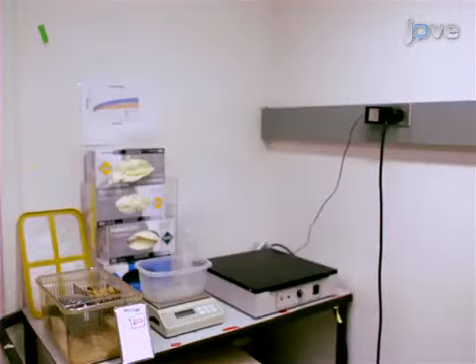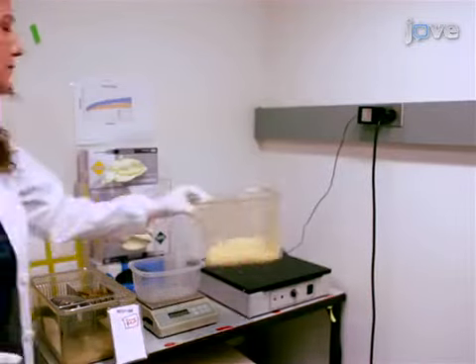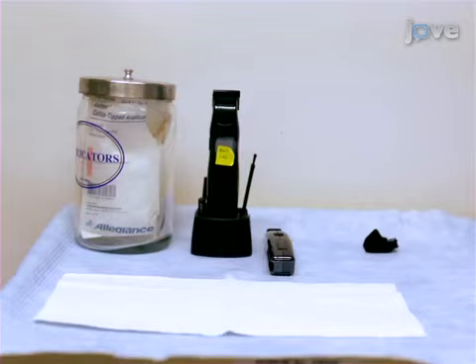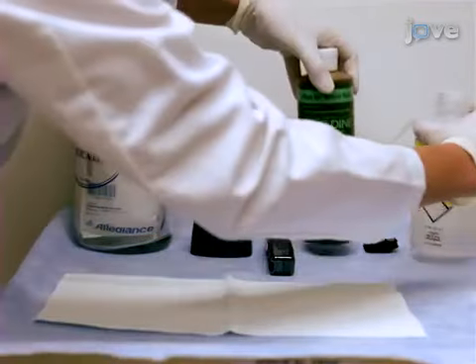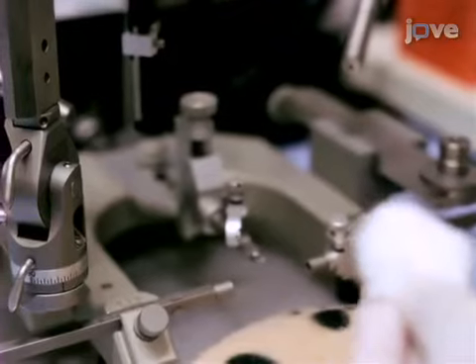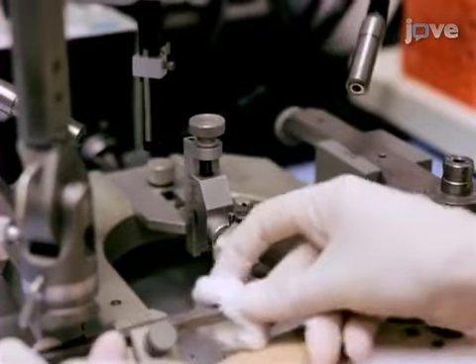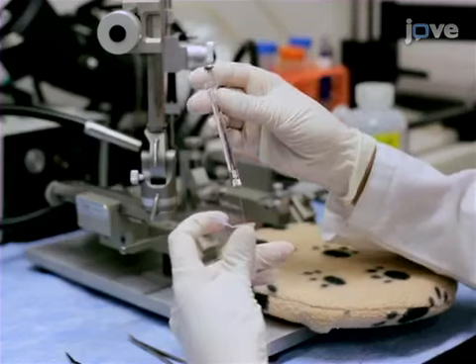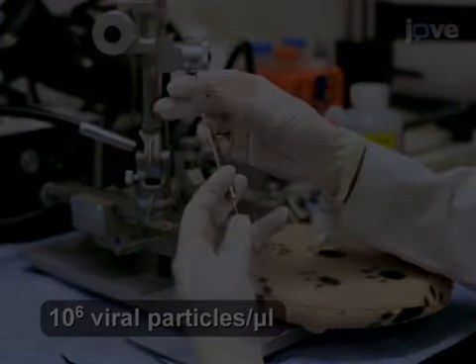To begin, place a mouse cage with bedding on a heat block to warm for postoperative recovery. Set up an electric razor for shaving the head and ethanol and iodine to sterilize the scalp. Use 70% ethanol to wipe down ear bars and mouth hold of the Stereotax. Using a 5 microliter Hamilton syringe, draw up 5 microliters.